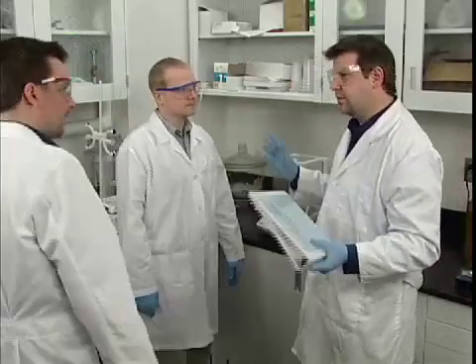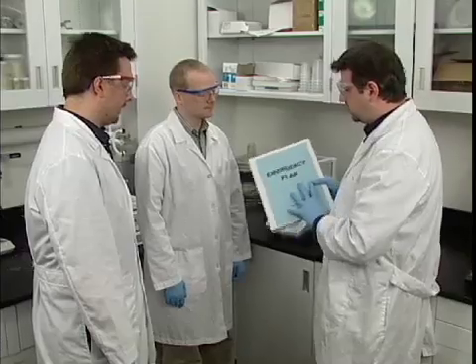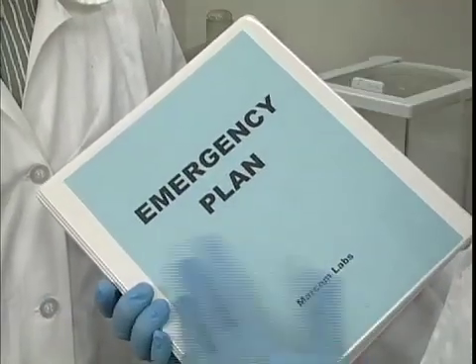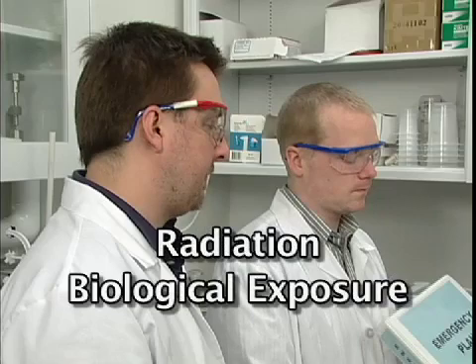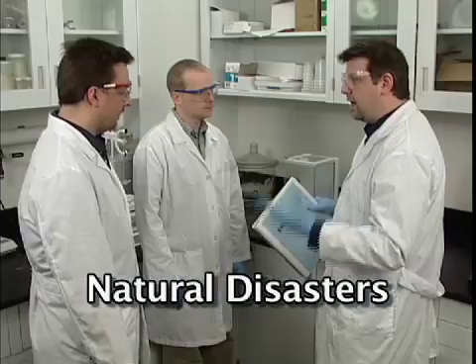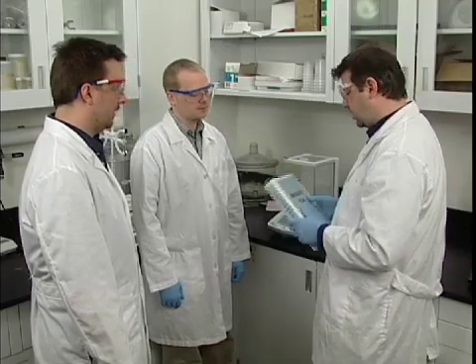To help you deal with these situations, your laboratory has developed an emergency plan, which takes into account the types of incidents you could face. There may be sections on chemical spills and fires, as well as more unusual hazards like radiation or biological exposure. Natural disasters such as earthquakes, floods, and tornadoes will also be addressed. You need to get a copy of the plan and read it.